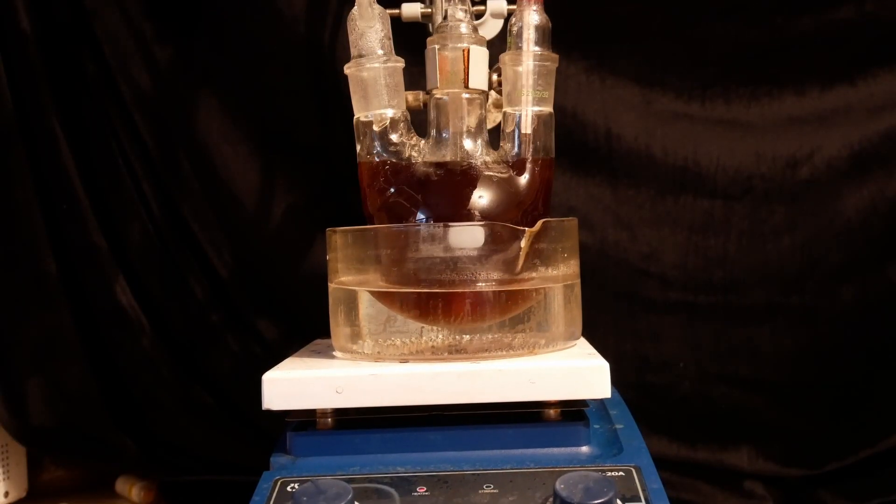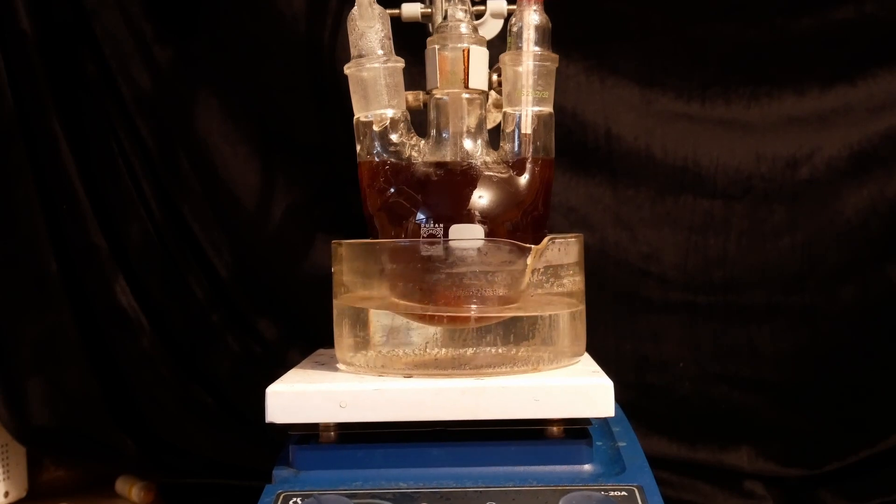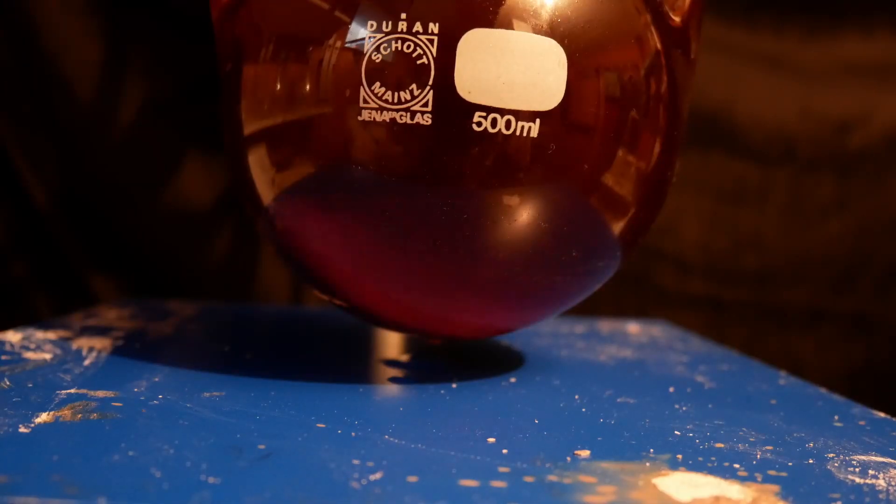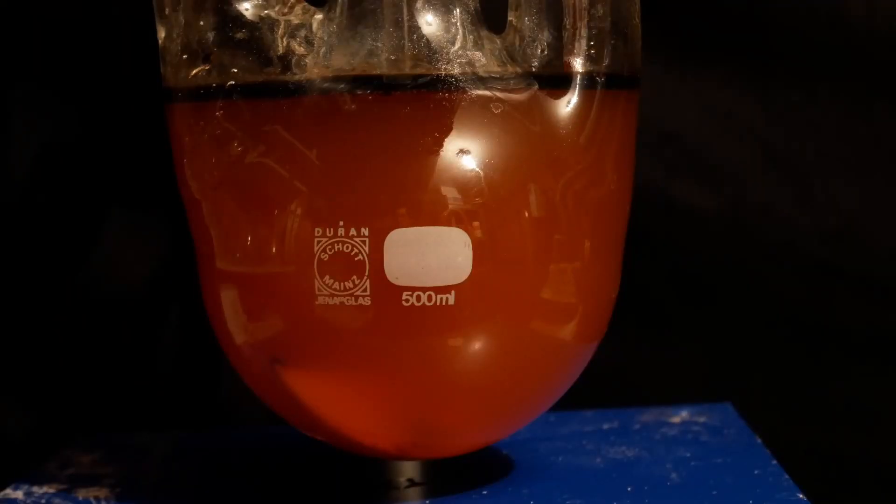After heating is done, all of the solid pieces have disappeared and the liquid is much clearer than before. Also, when left to stand for a bit, a thick black tarry layer forms on top.